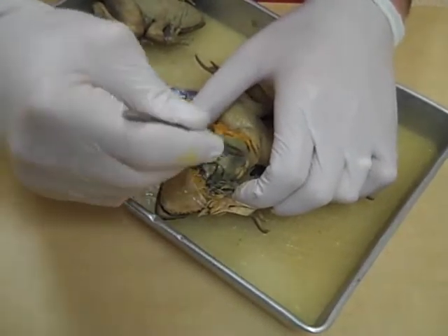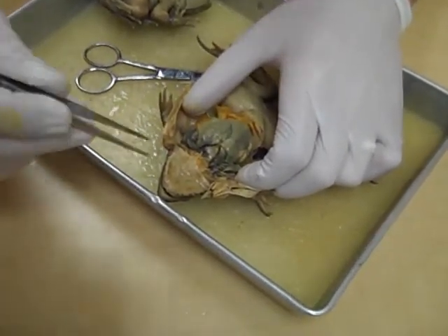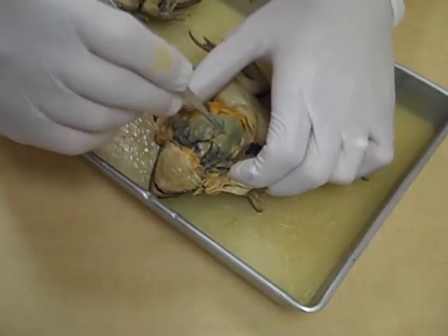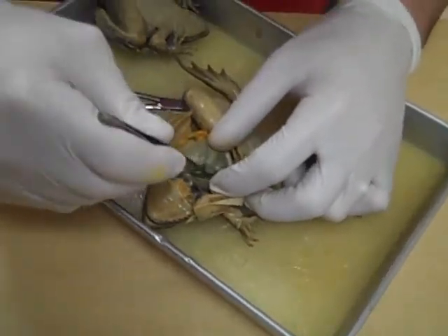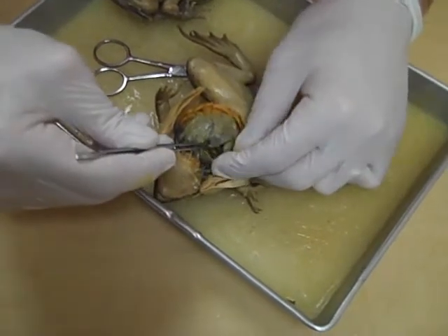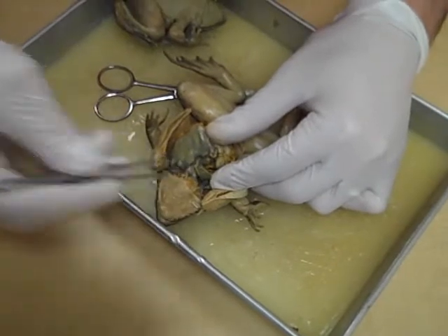The first structure that they actually see is this big one here that covers everything, and that's the liver — very large and lobed. What's associated with the liver is the gallbladder. If we lift up this part right here, we find — oh, this one's kind of small — there's a little bag or a little sock down here which is the gallbladder.